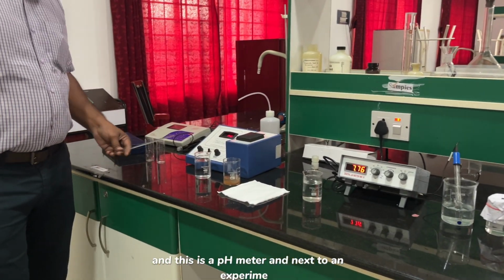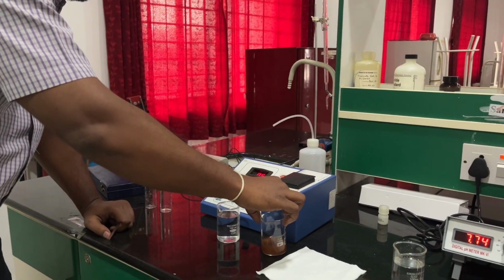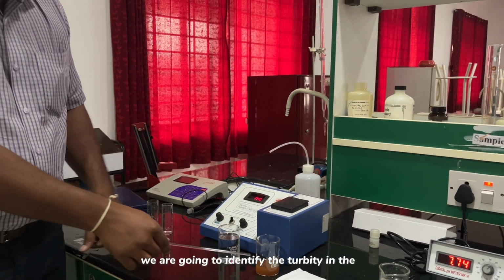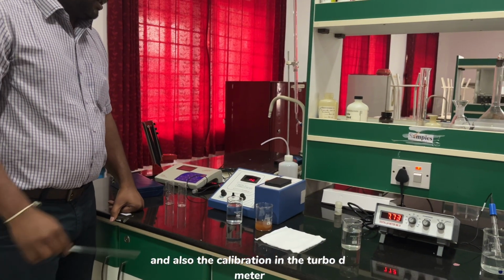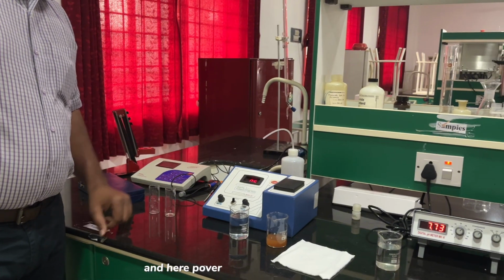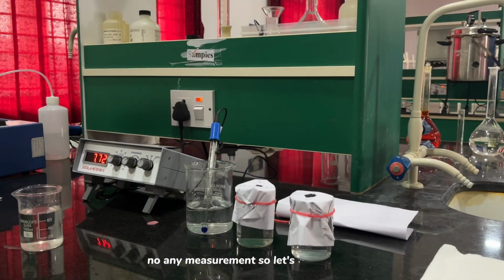Next, in the experiment we are going to see turbidity in water. This is a turbidity sample we have with us, and this is a pure sample. Based on these, we are going to identify the turbidity in the prescribed water, and also calibrate the turbidity meter. This is the turbidity meter, which shows the answers in digital format. Turbidity is measured in NTU, that is Nephelometric Turbidity Unit, and pH has no unit. So let's start with the pH.